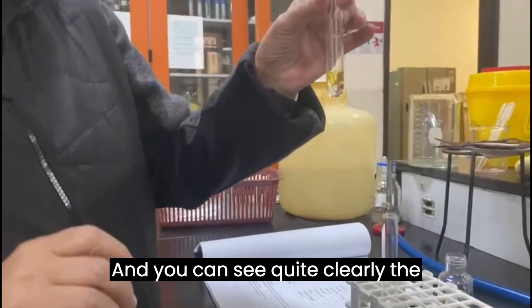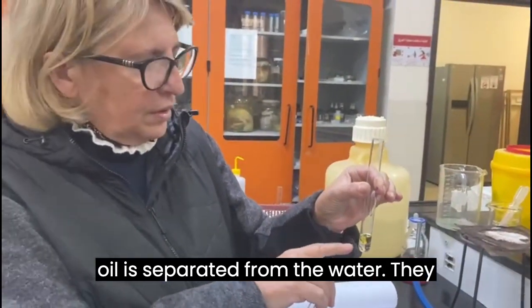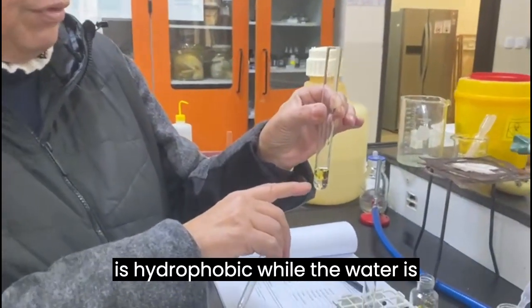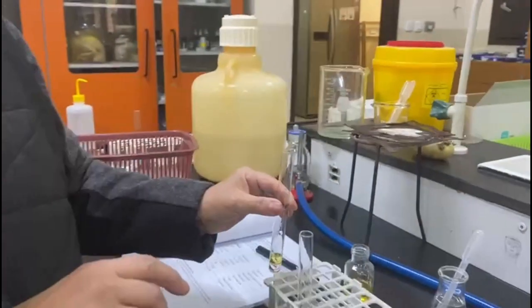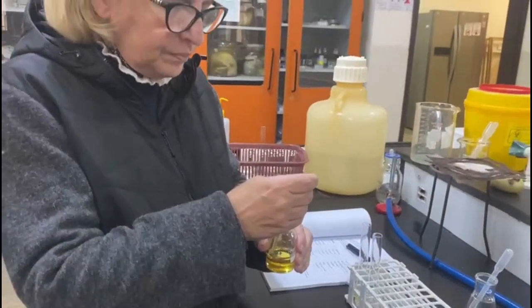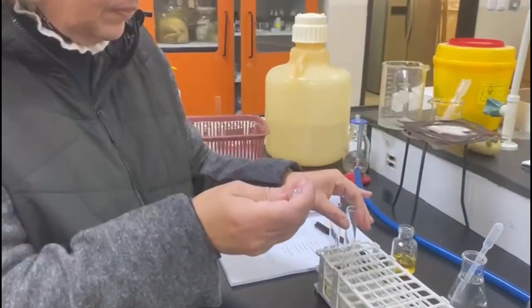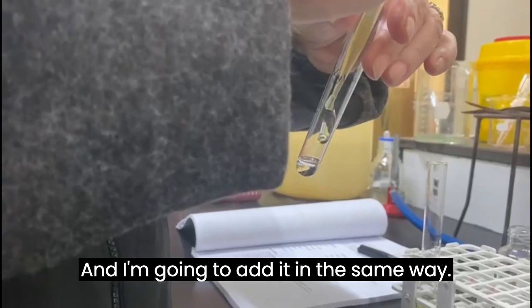And you can see quite clearly the oil is separated from the water. They don't mix together because the oil is hydrophobic while the water is hydrophilic, obviously. Okay? Do the same with the xylene. And I'm going to add it in the same way.